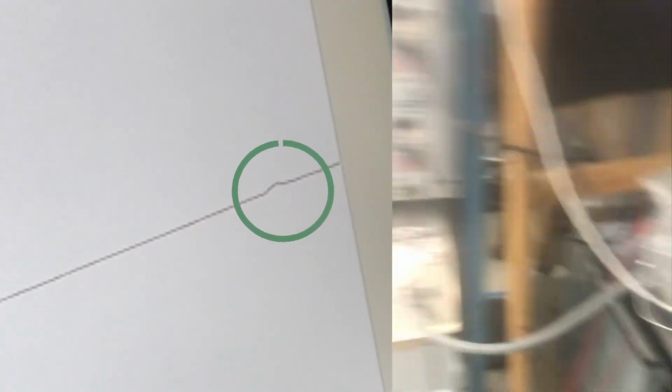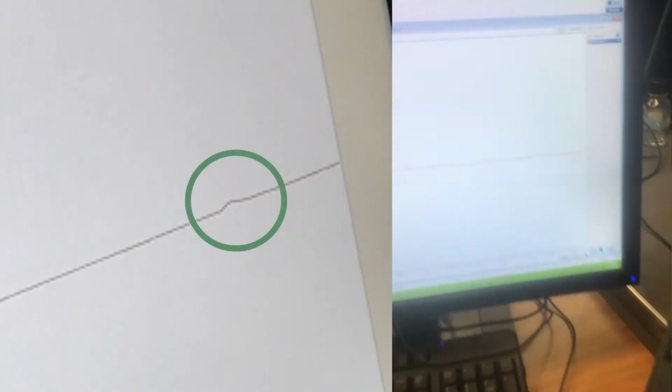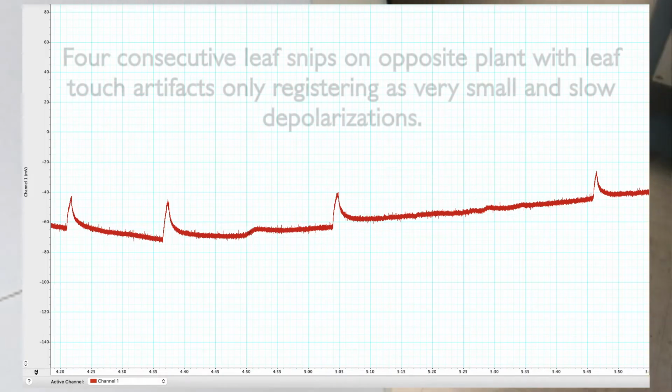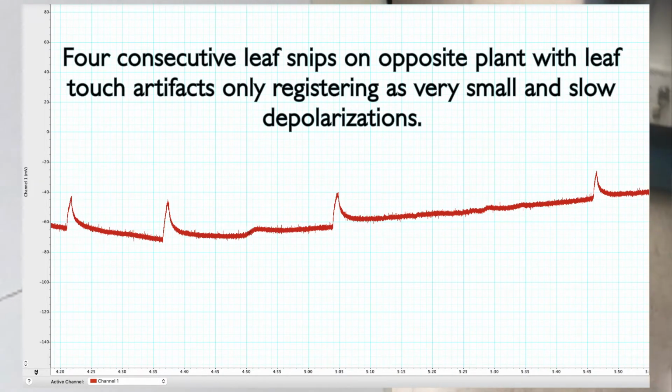Oh, we want to break the mycelium though too. Yep. Let's just nip this one. Nip. Yeah, I still see a little artifact. So that's the last nip. That was right there, and you got it on the camera. So that was at 5:45 about.